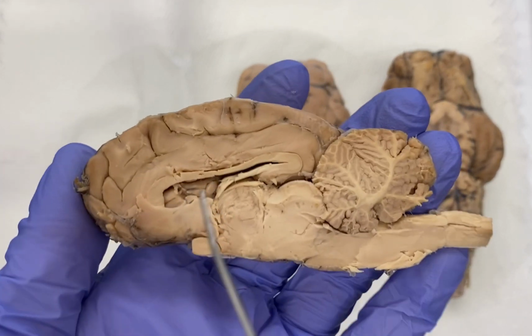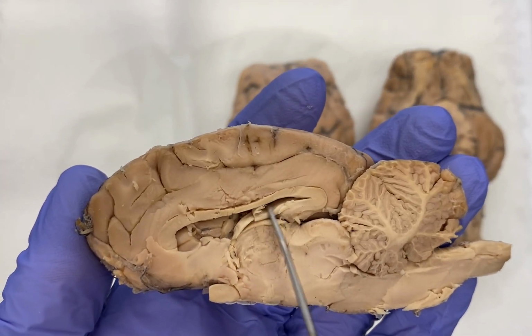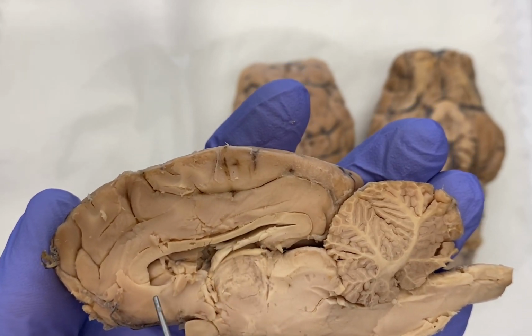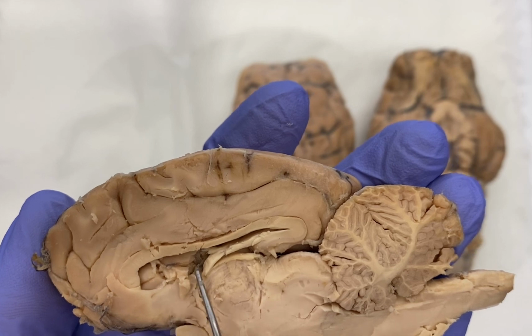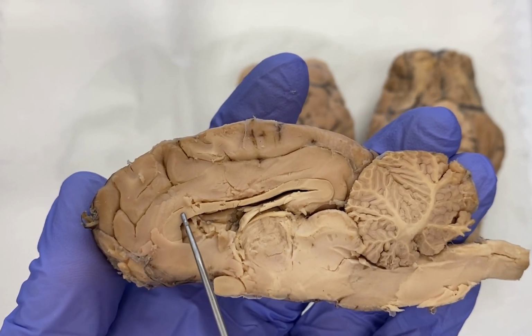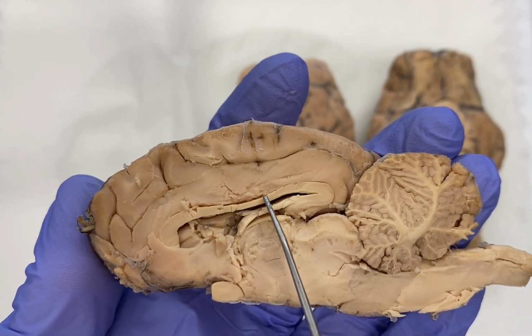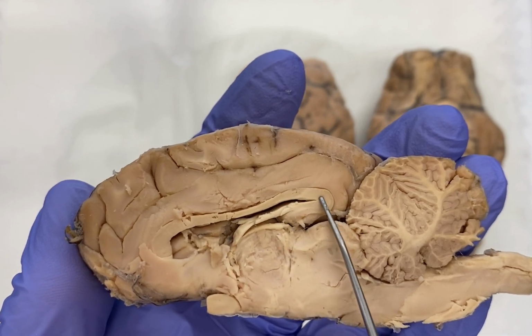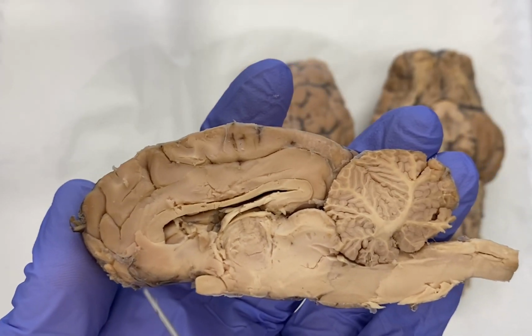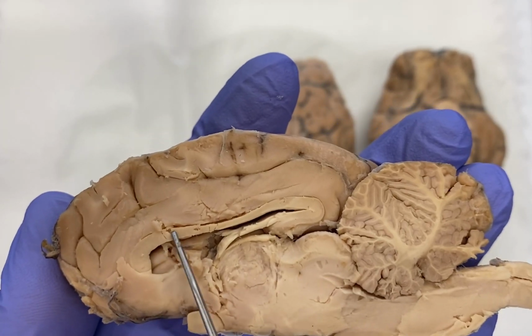Now, associated here and nearby is our ventricle. So again, recall, which ventricle is this, where my pointer is? Hopefully you can answer that. Remember, that is our lateral ventricle. You have this white matter region here, all of this white matter tissue running all through here. This is something called the corpus callosum, all this white matter here.